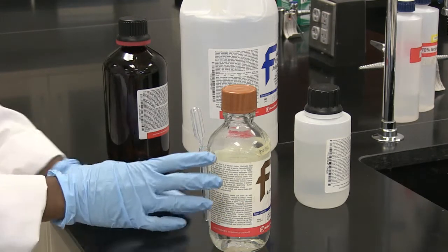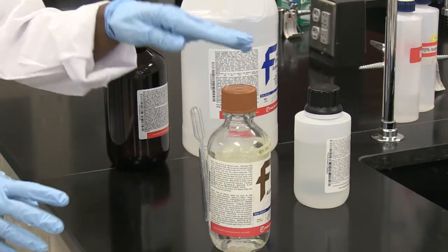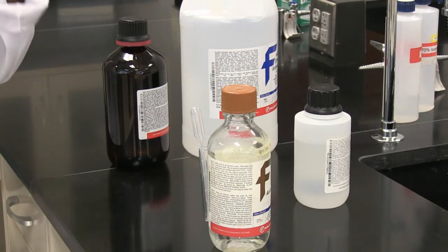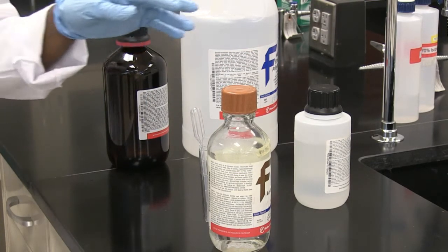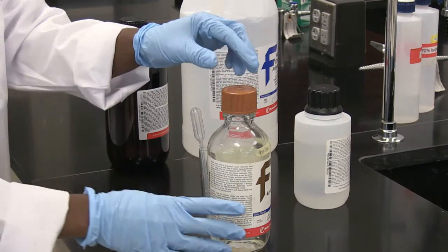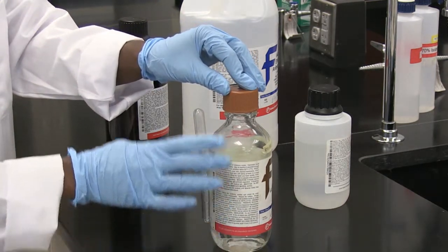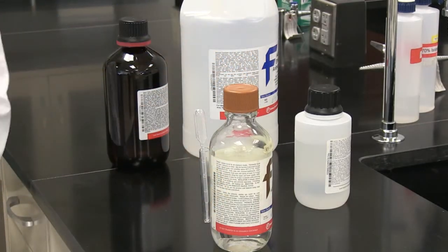There are other guidelines to follow as well, which you'll find on the bottle — what to do if it spills on you, what to do if it gets in your eyes. We'll talk about that later. Just make sure you look at the labels to know how to handle this particular chemical.